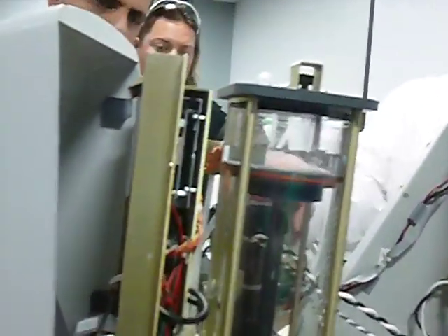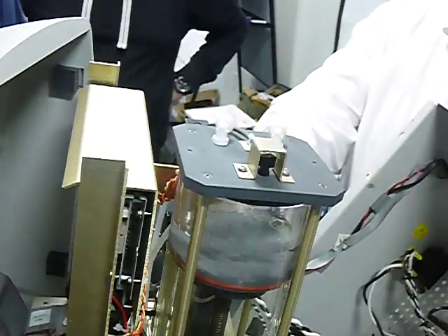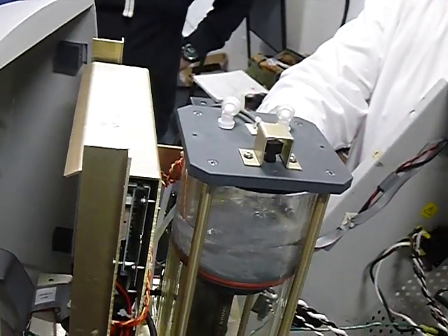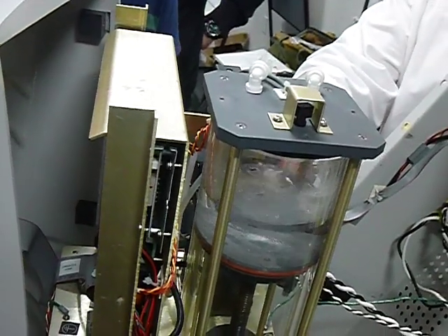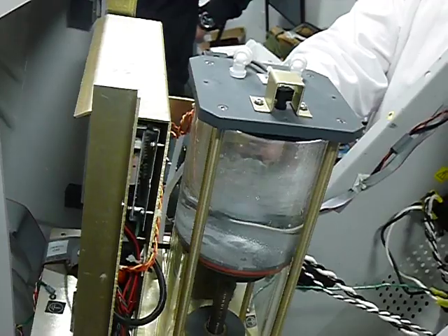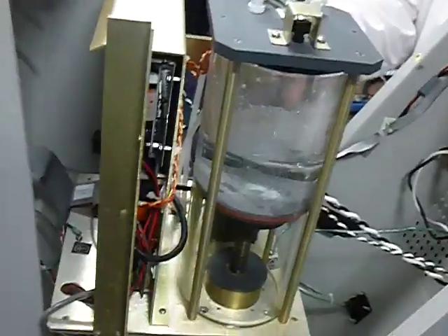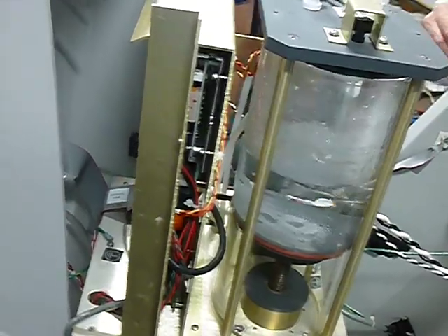All right. So now this piston's coming down, all right? What's driving this piston? Motor. This motor, okay? Inside the motor, what's holding this down is a 6.3 amp fuse. That's its protection. It's a T 6.3 amp fuse. T is for time delay. And you see on those little round fuses, T is going to be time delay, F is going to be a fast blow.